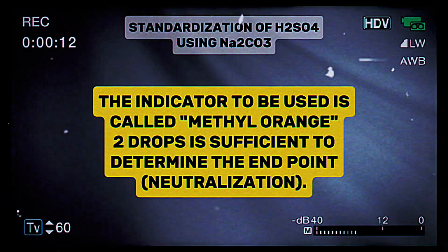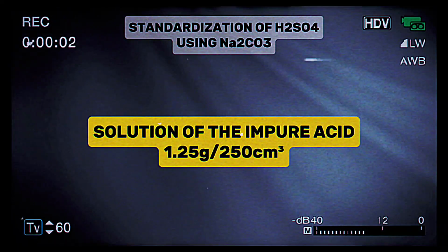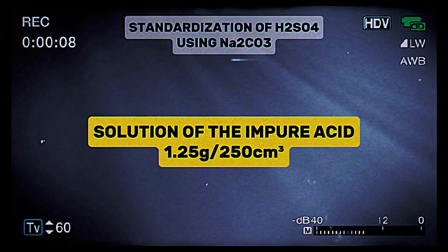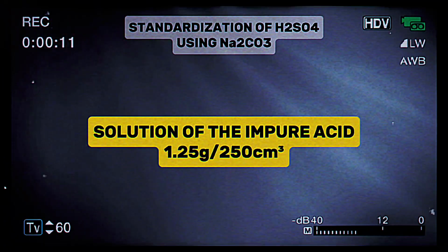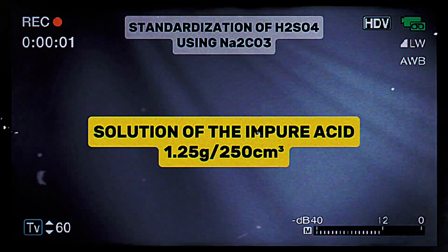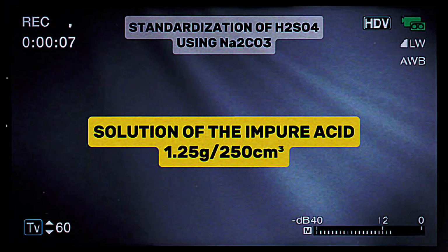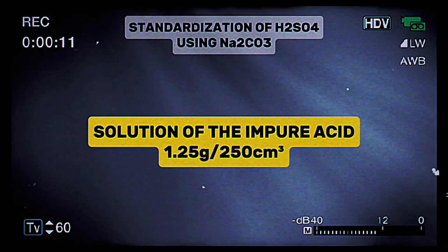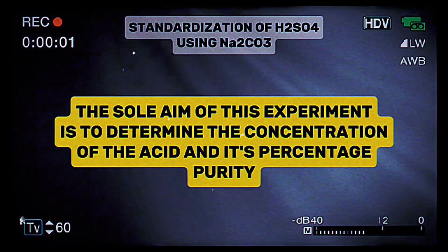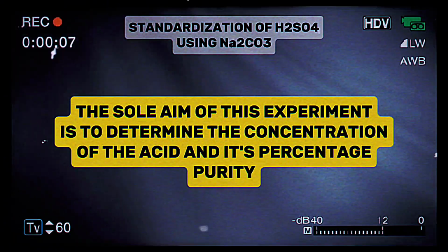A solution of the impure acid will be provided, containing 1.25 gram per 250 cm cube. Note that this is the concentration of the impure acid that has been given, so you're going to make use of this data somewhere else in the course of this experiment. Like I said previously, our sole aim is to determine the concentration of the impure acid using sodium trioxocarbonate(IV) and to determine its percentage purity.